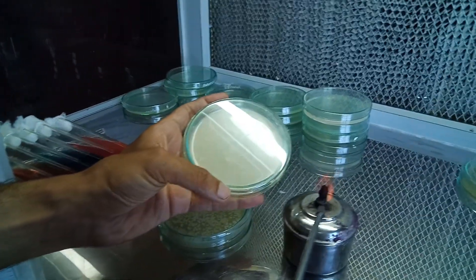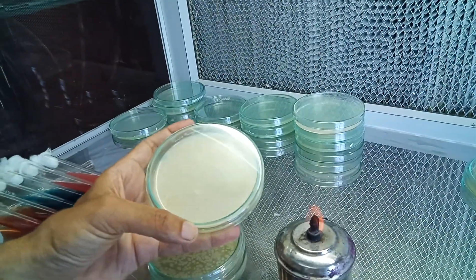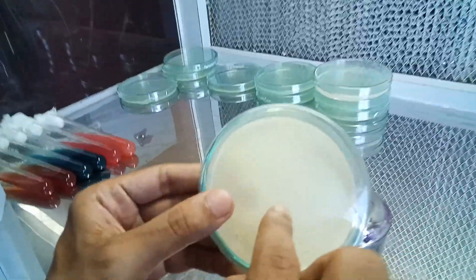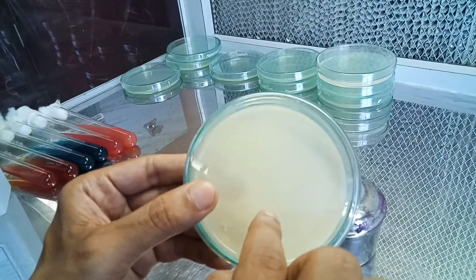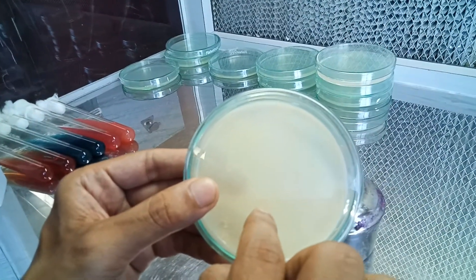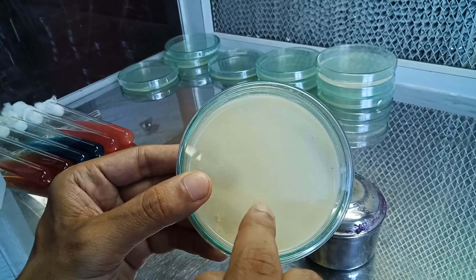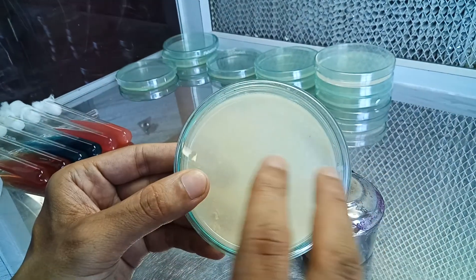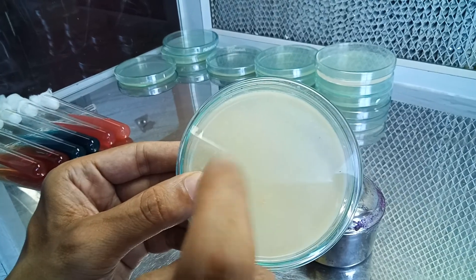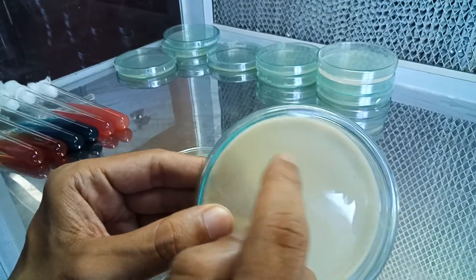After that, we'll heat the loop again and the plate is done. We'll incubate it at 37 degrees centigrade for 24 hours, and it may take up to 48 hours — we may have to incubate it for two days.